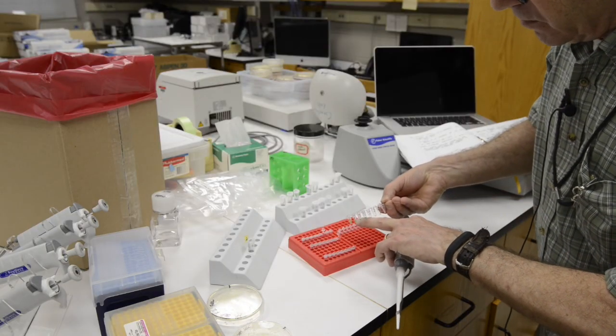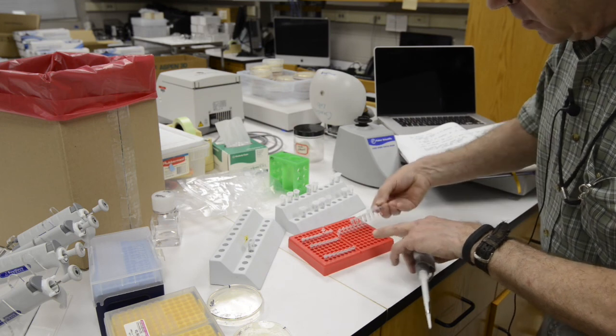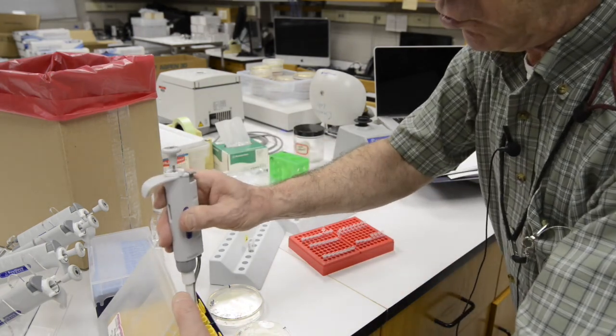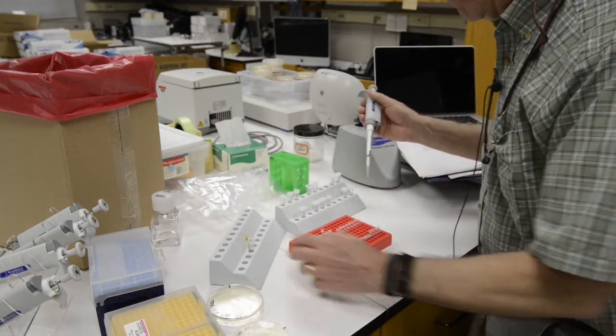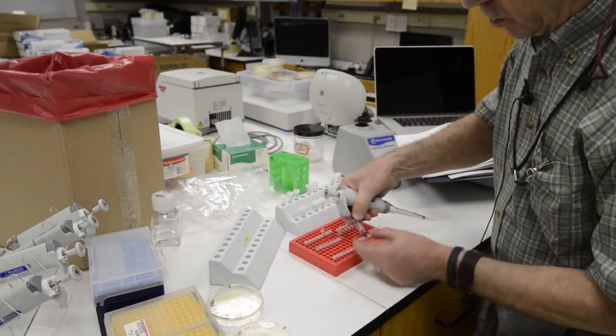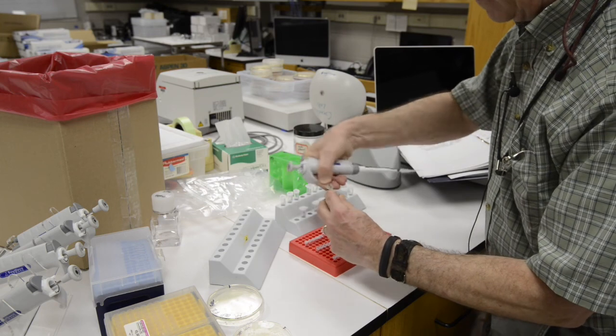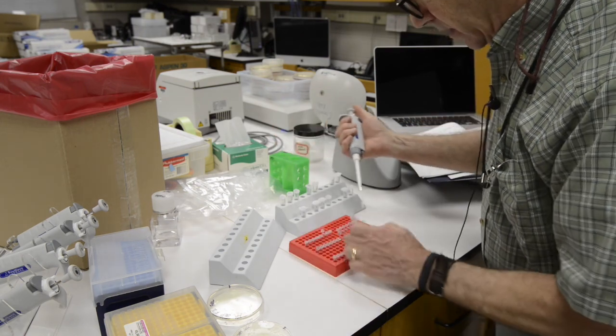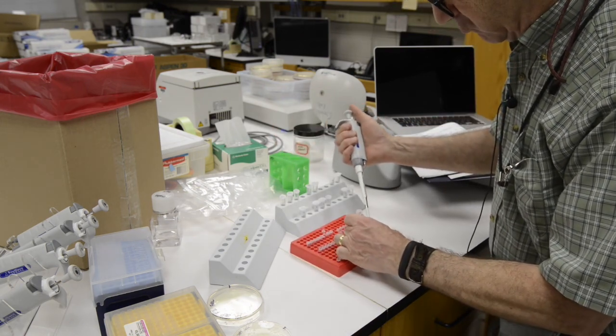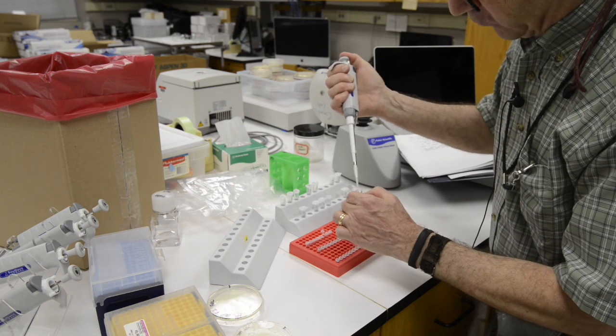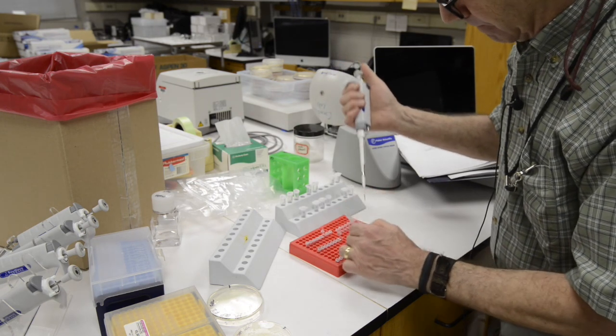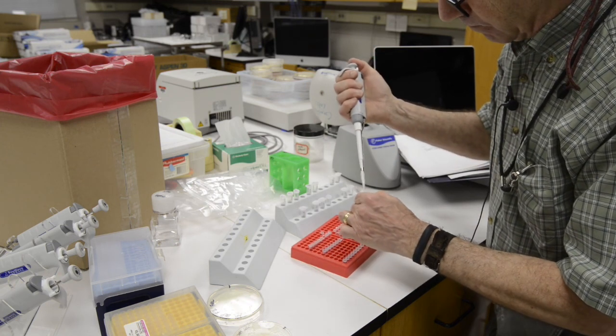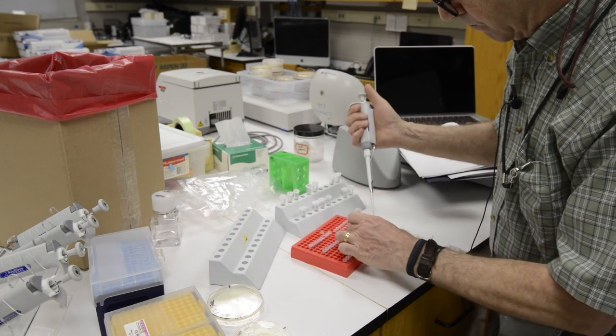Your instructor will also be providing you with a PCR master mix that contains the forward and reverse primers for PCR. These are the primers that are going to be used for amplifying the 16S ribosomal RNA gene. And this master mix will also have, in all likelihood, a loading dye. So you'll see in a moment that the master mix has a color to it, typically it's a purple color. That's going to allow you to see the sample when you put it into the gel.